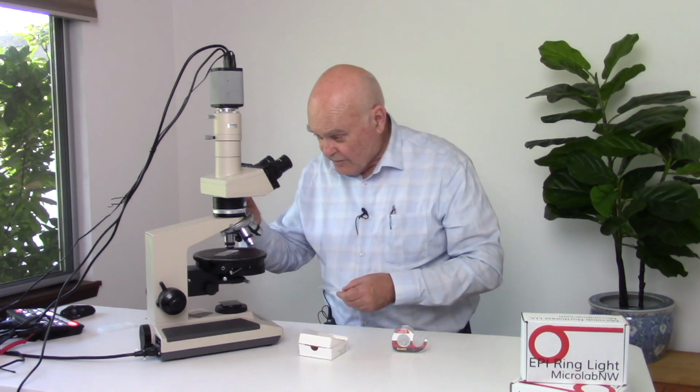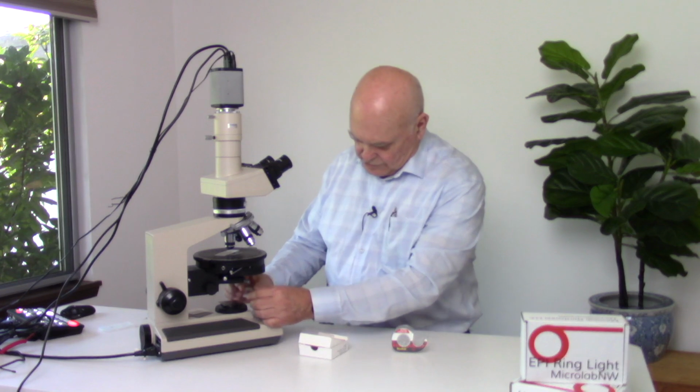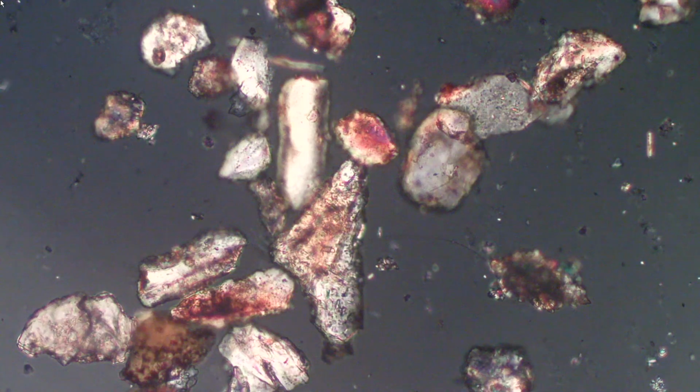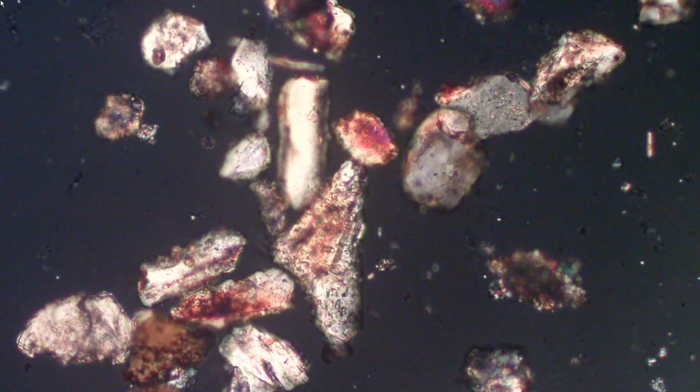Put down 4 or 5 layers, and then simply slide in your quarter wave plate just under the analyzer, rotate your quarter wave plate down below to get full cross-polarized, circular cross-polarized light. There we go. That's all there is to it.